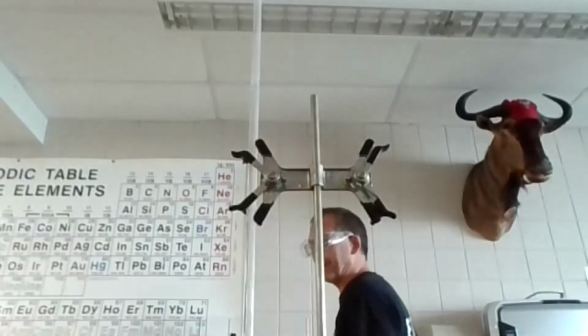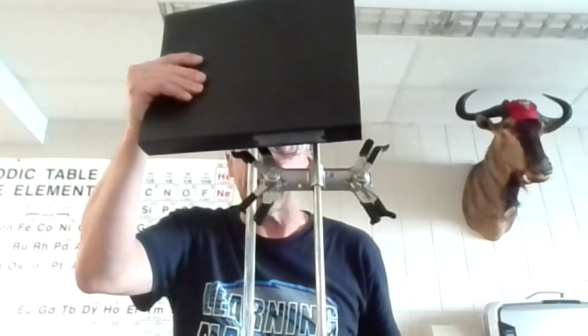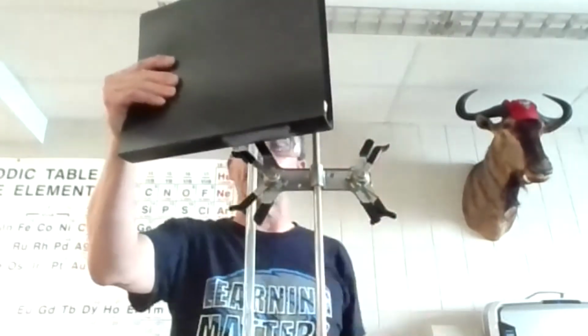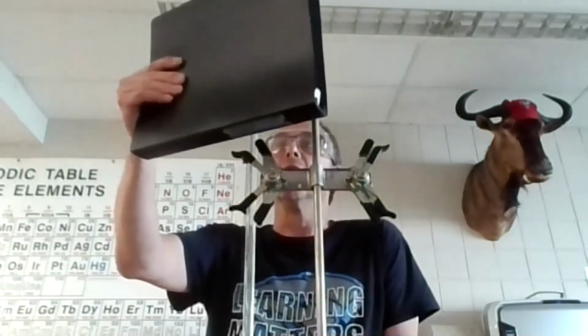I'm going to go to a black backdrop because I can't see. These have white numbers, and it looks like I'm right at about 17. It looks like right on 17 at the bottom of the meniscus, 17.0. Make sure you know they go from top to bottom. You're not subtracting from the 50. You really don't know how much is in there, but you're just going to take a beginning reading, an ending reading, and then just take the difference between the two.